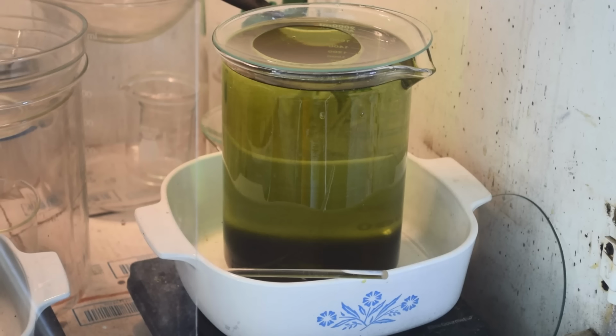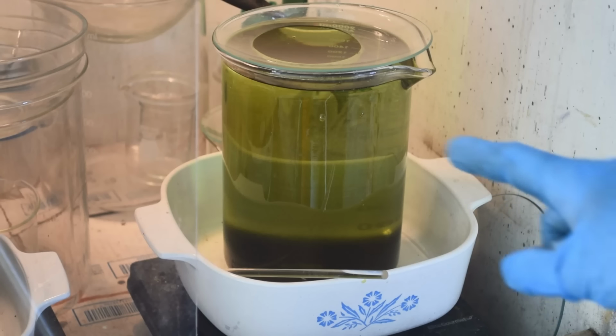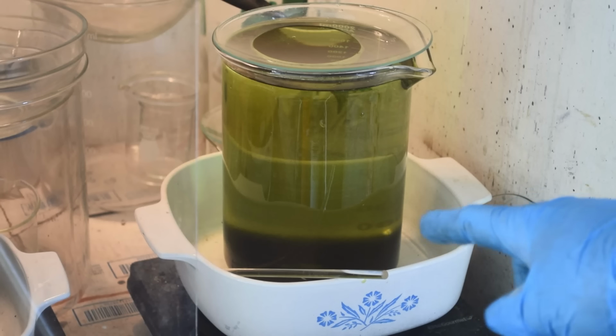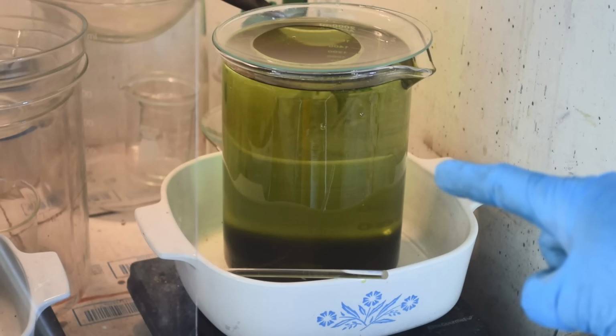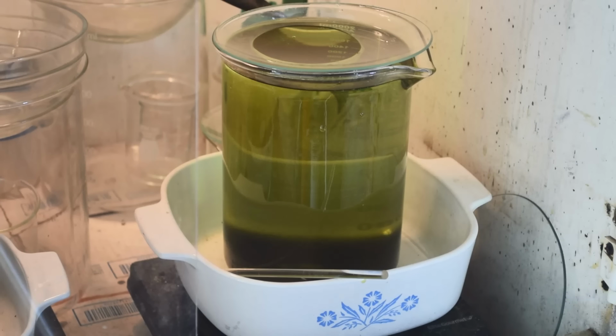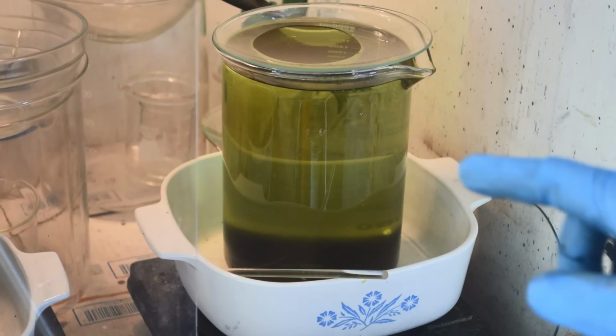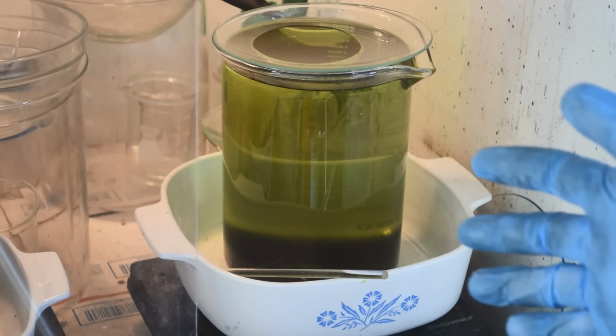Wow, that is one full beaker. But look, the liquid's cleared up. There's a layer of gold on the bottom. It's been maybe a half hour. Okay. Another thing I like about using iron sulfate is the gold settles out fast.